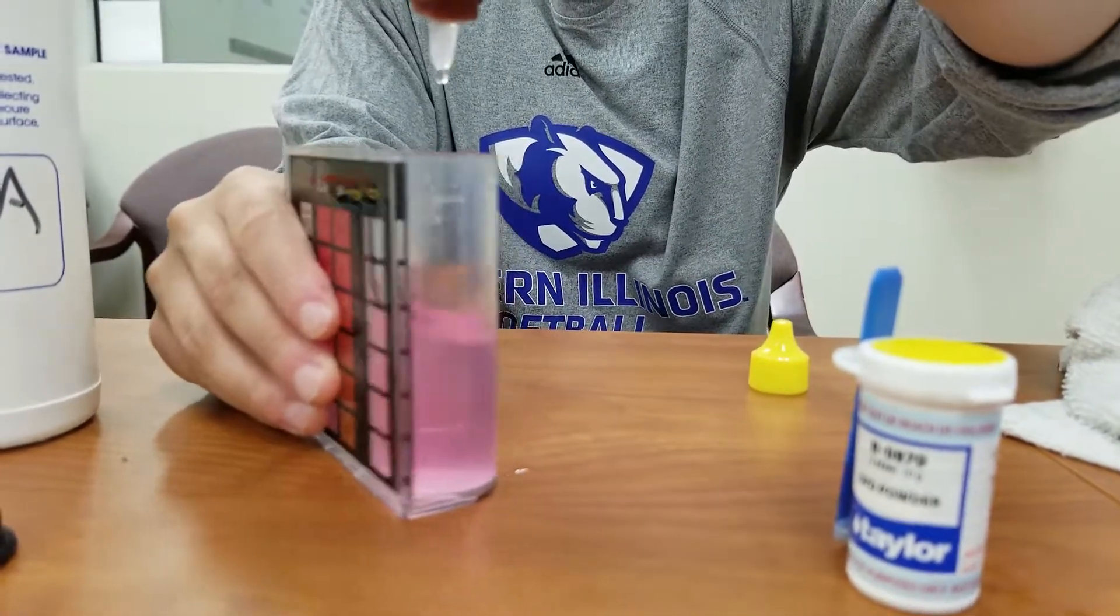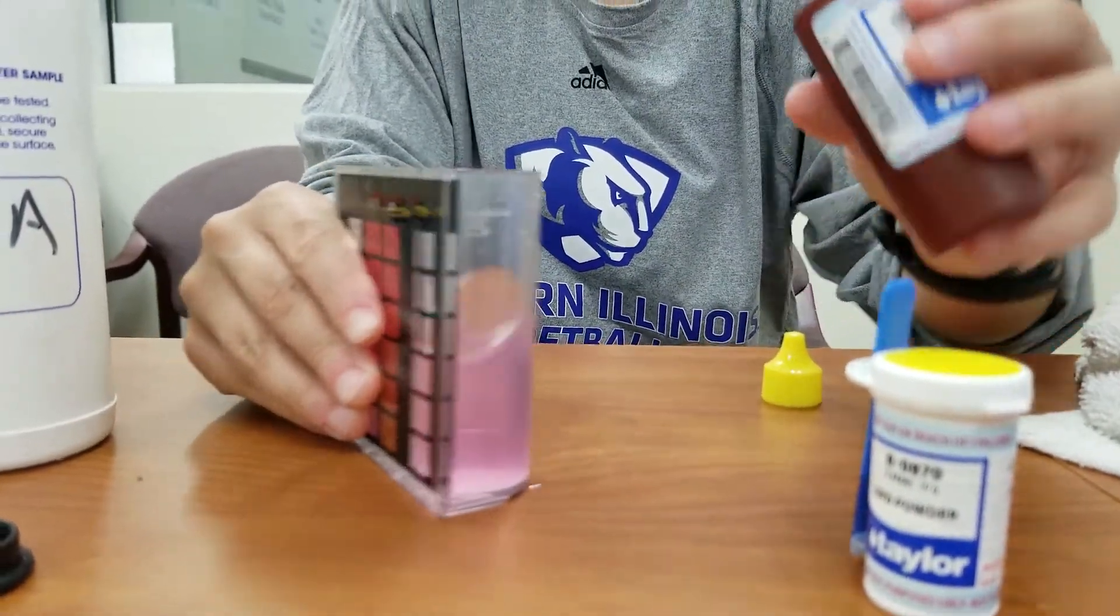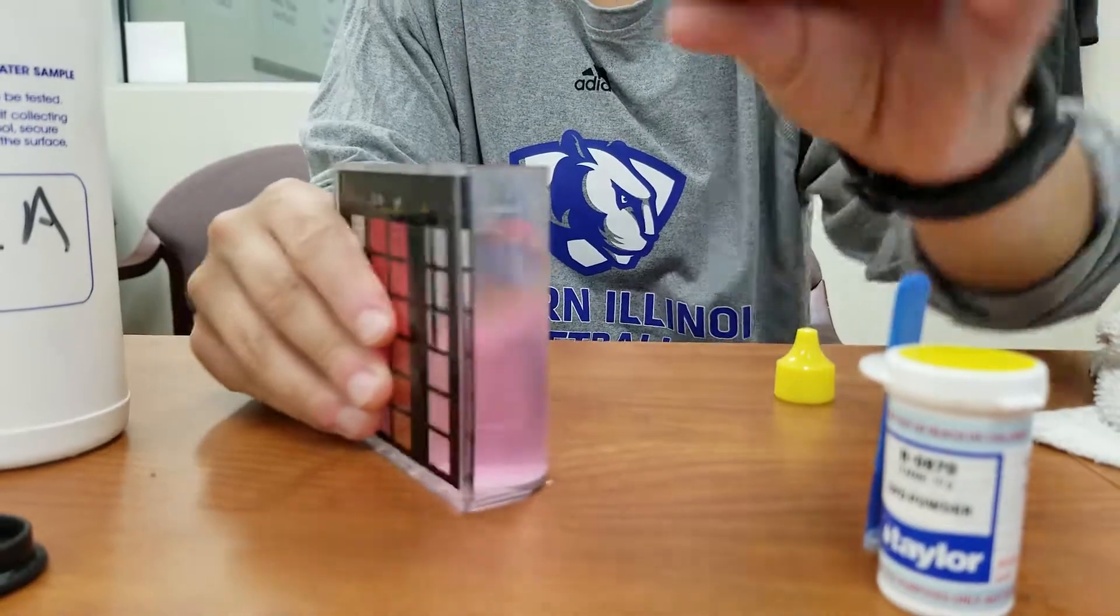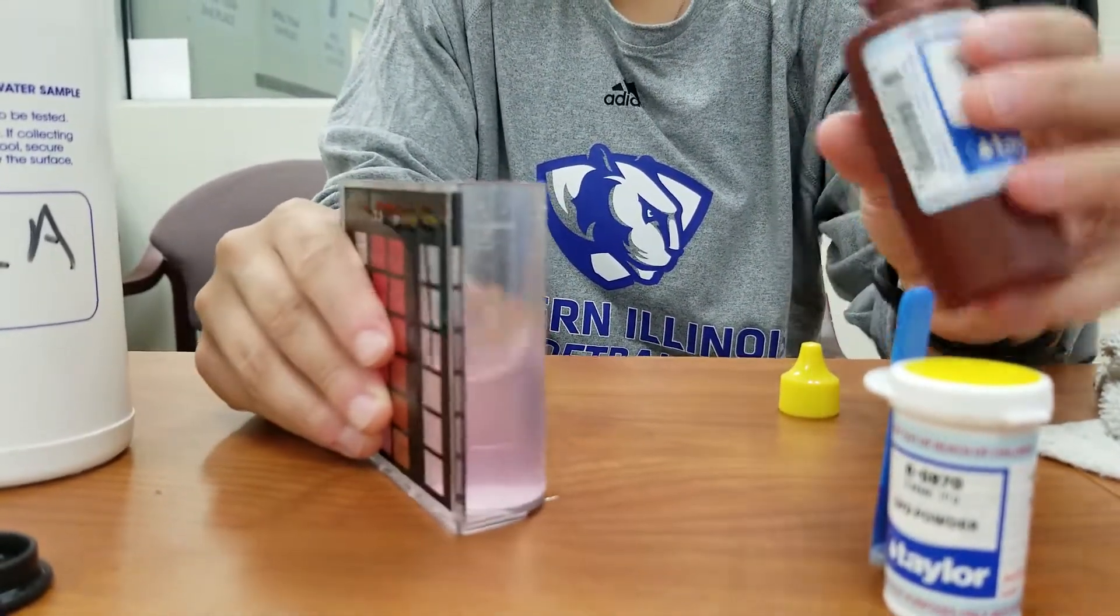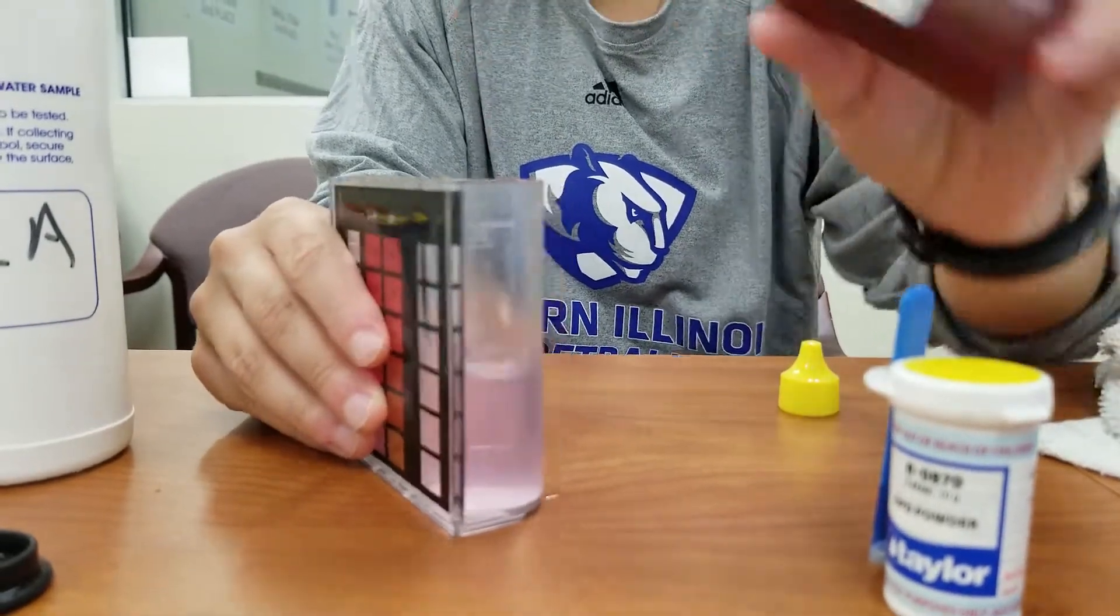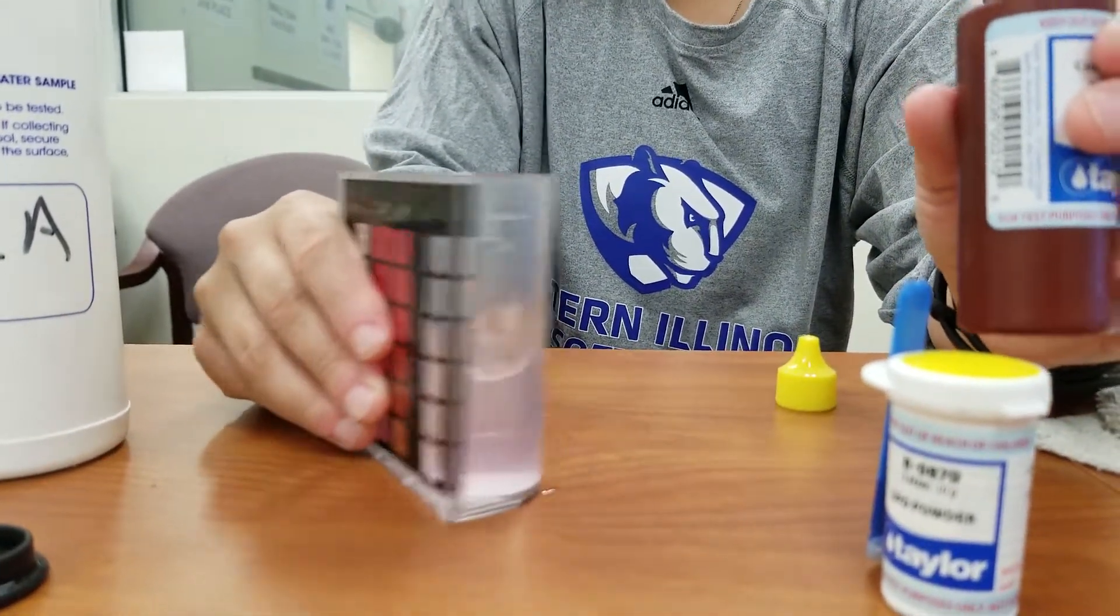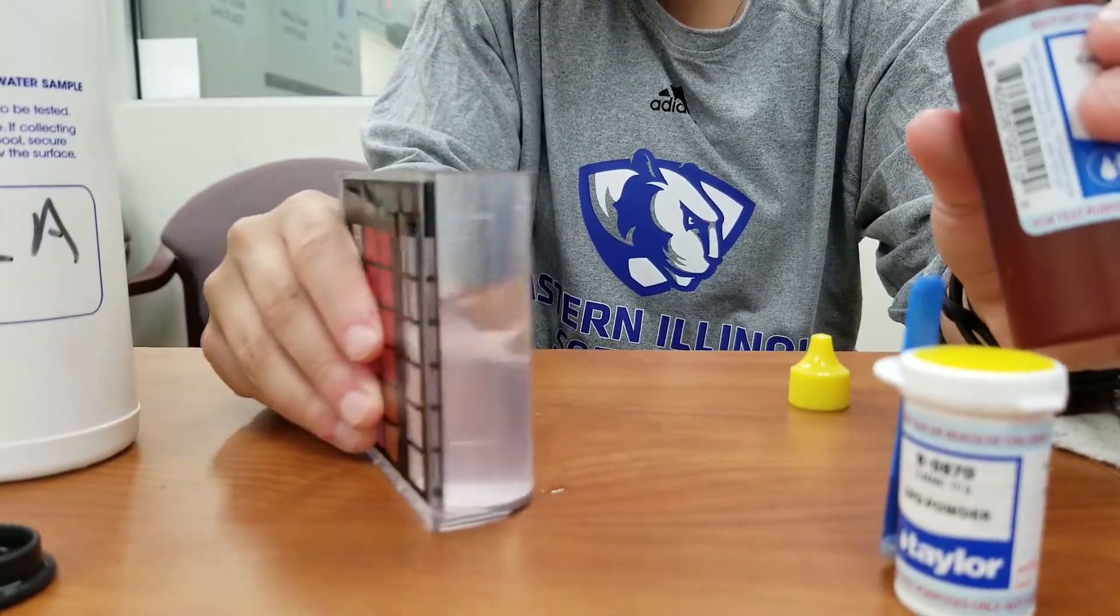So it's starting to change a little bit lighter, but we want it to be clear. Alright. So that looks like clear.